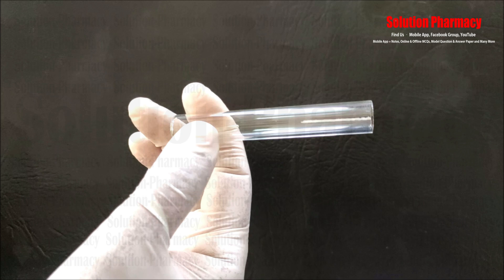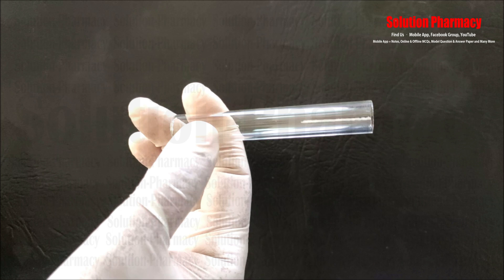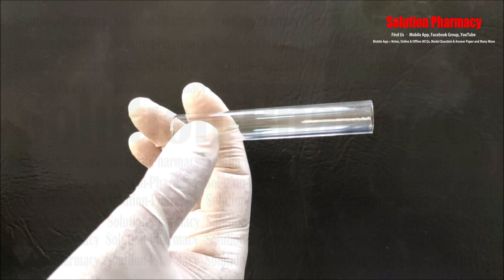When we place this cuvette inside the spectrophotometer, the beam of light passes through the sample within the cuvette to measure absorbance, transmittance, and fluorescence for analysis. Because this is a colorimeter glass cuvette, it is used only for the analysis of samples in the visible range.